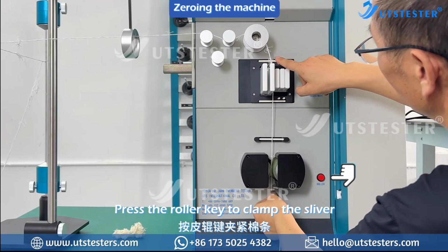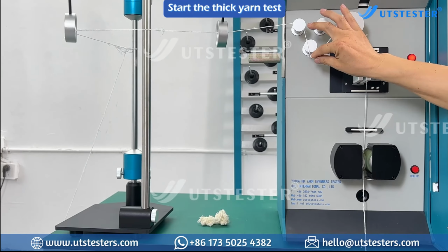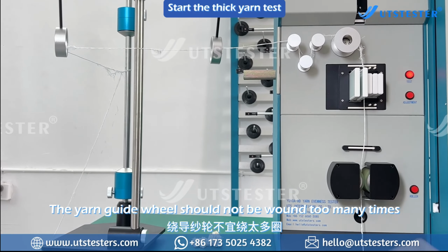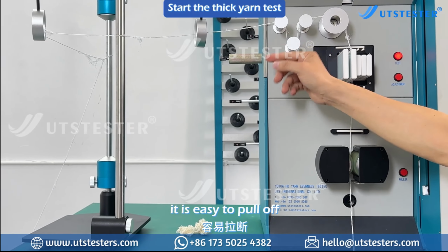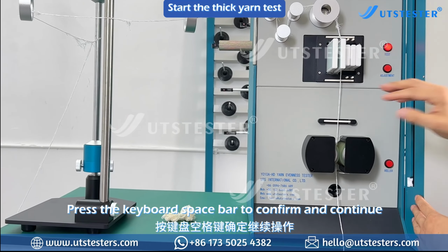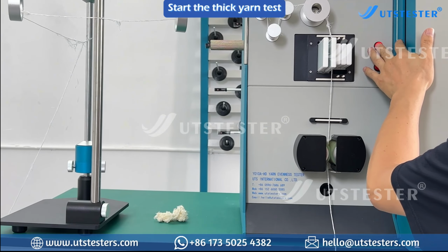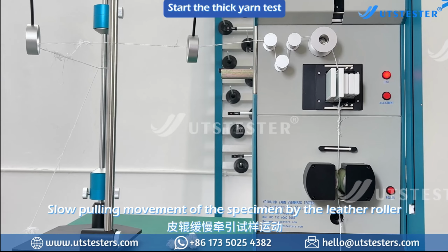Press the roller key to clamp the sliver. The yarn guide wheel should not be wound too many times. It is easy to pull off. Press the keyboard spacebar to confirm and continue. Slow pulling movement of the specimen by the leather roller.